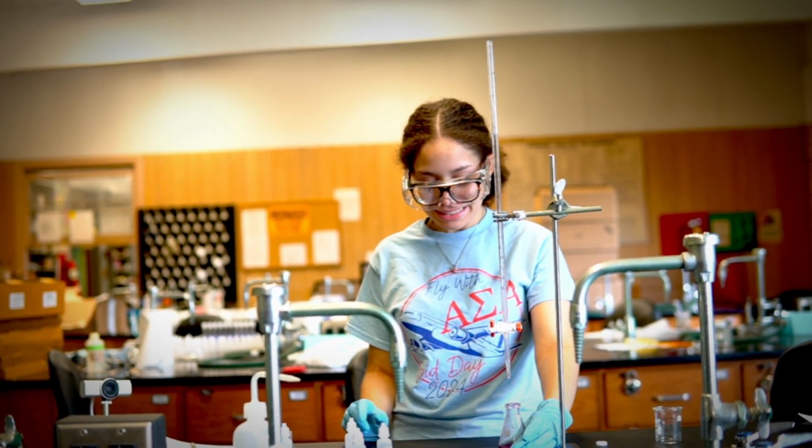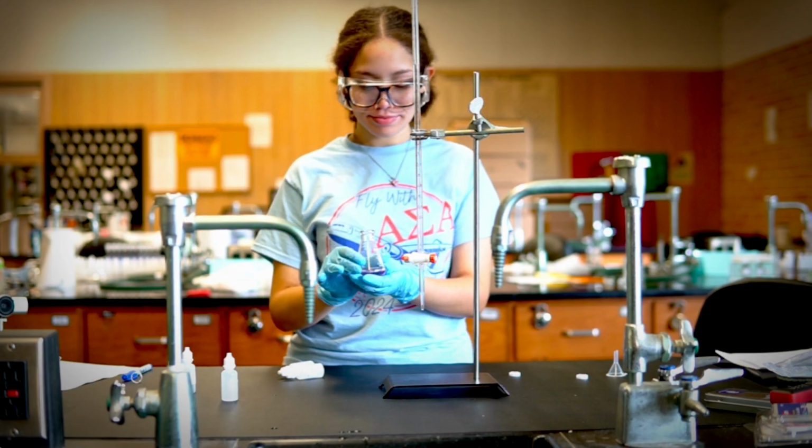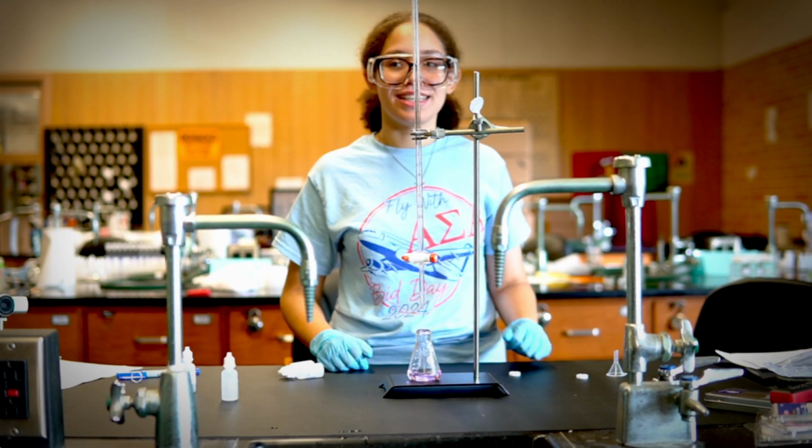So when you do it, you should get a color that looks like this, right? A color that looks like this, just light pink, right? And this only comes when you are very careful and you start to slow down when you close. So this should be on your second titration. If you don't get a nice light pink, you can do another titration, but please don't do more than three. I don't think we have enough material for that. Just record your data for the three titrations. All right. And then after that, you are done with your titration.